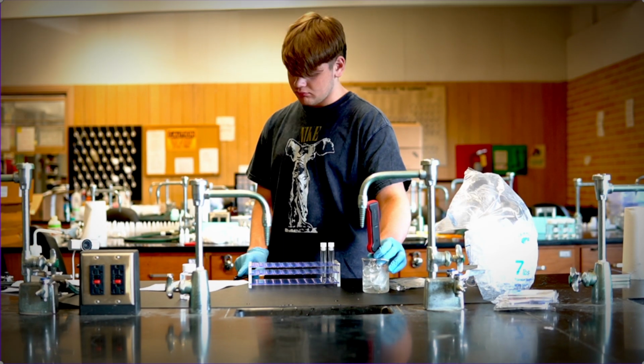If it doesn't freeze, go all the way to 5 minutes, which is every 30 seconds all the way to 300 seconds. 300 seconds should be 5 minutes. It's a 5 minute experiment after you've set it up, and then you're going to go to the next part.